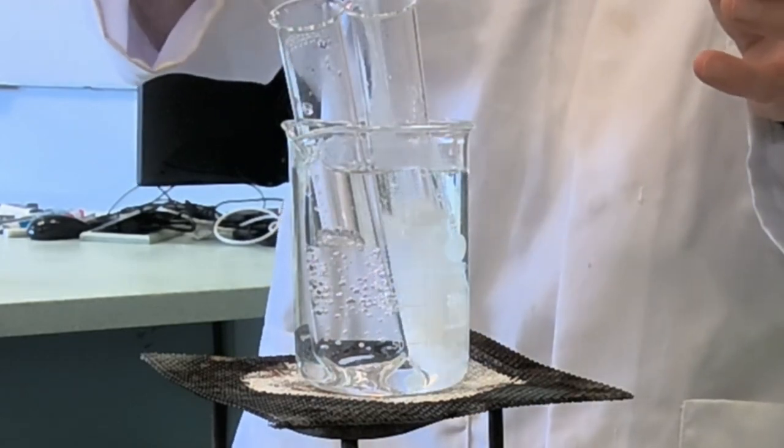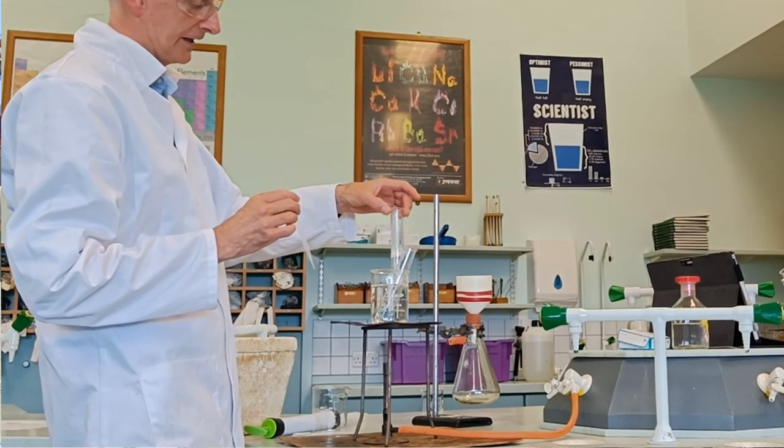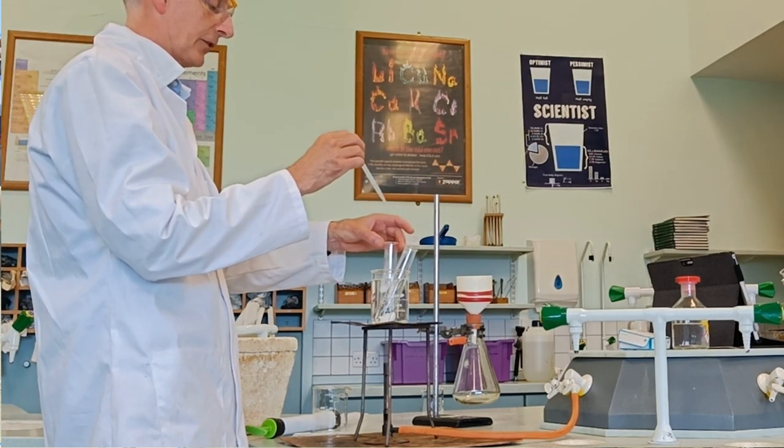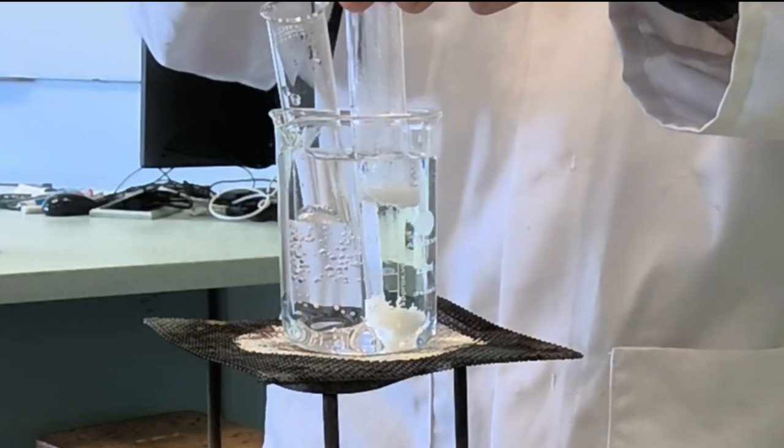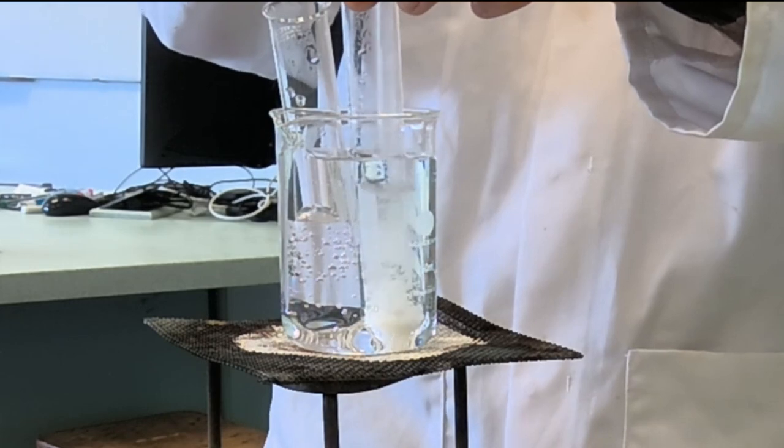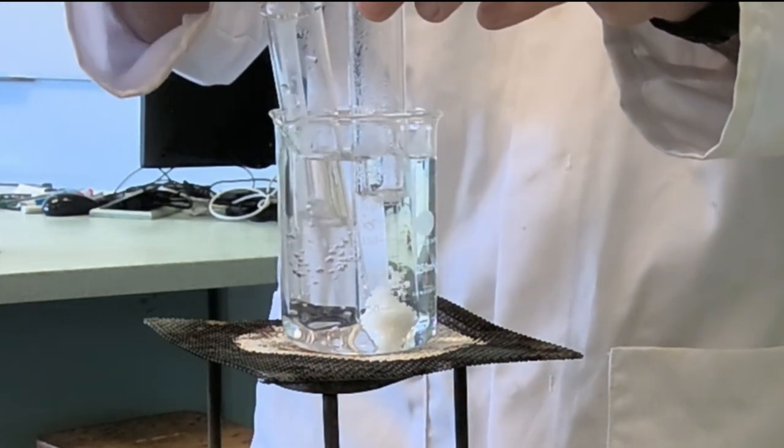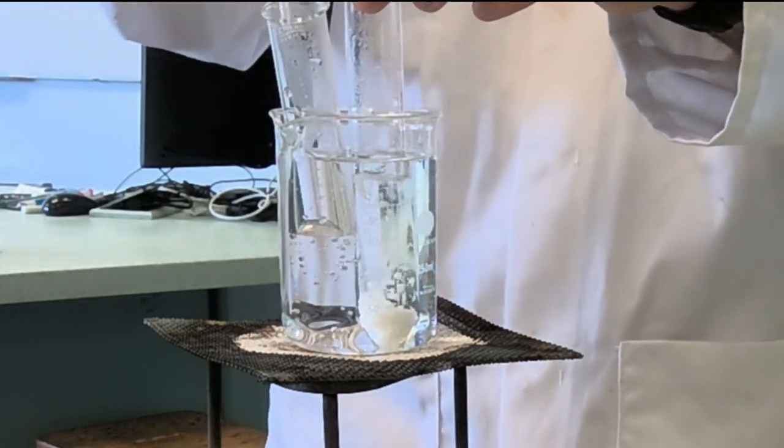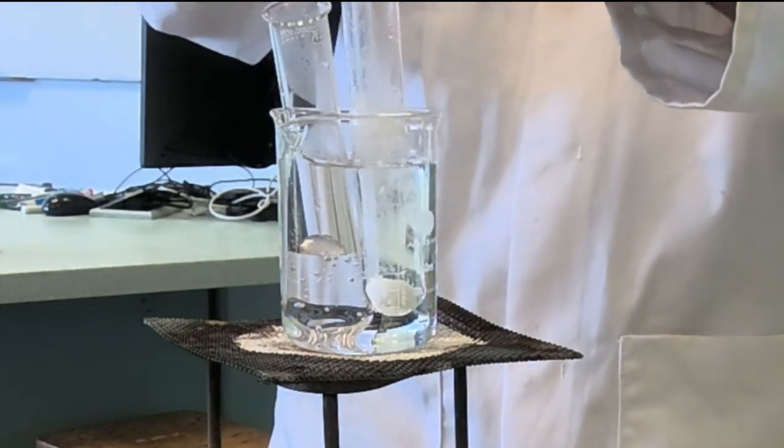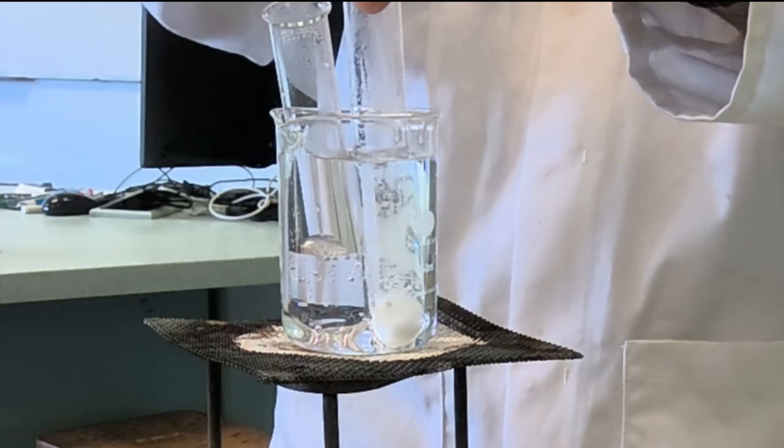We started off with a big boiling tube full of hot solvent. I put some in and it's starting to dissolve, but it's still not gone. You need to stir this up - if you tap it in there and give it a stir, you can help it dissolve. You need to be a bit patient. Give it time to dissolve in hot solvent, give it a proper stir, and make sure it's nice and hot.